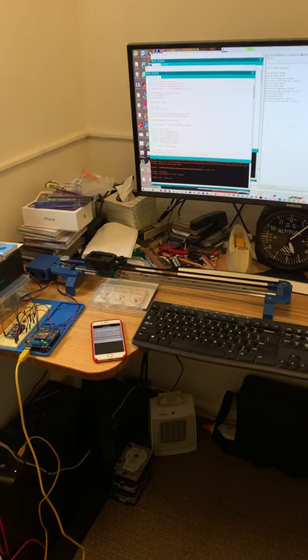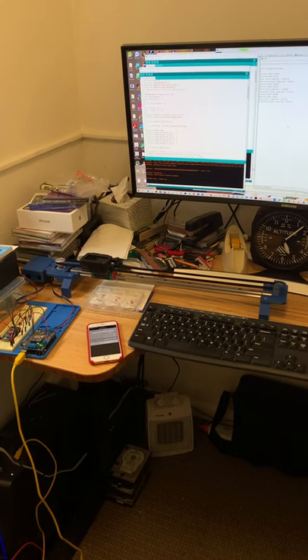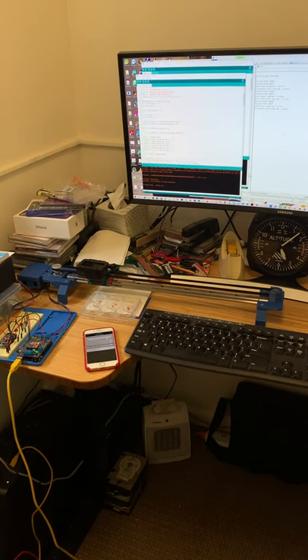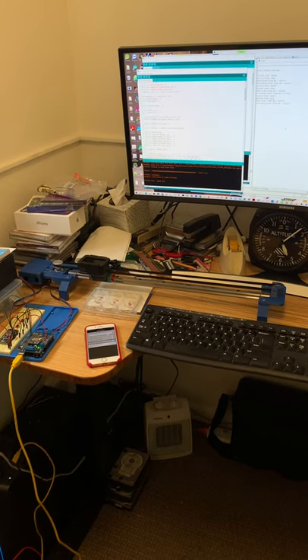Okay, I'm pretty excited to give a demo of the first running version of the prototype for the well plate video taken by a GoPro moving on the slider.